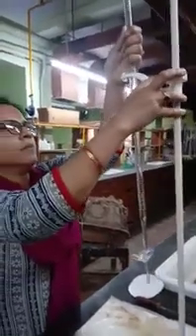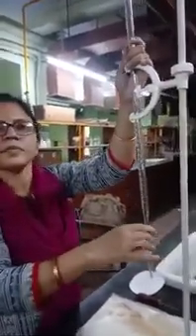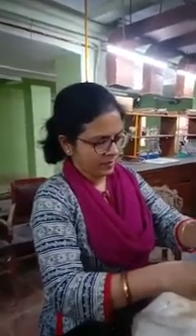Now if you add formalin solution, only the amine group will be blocked, and the carboxylic acid group can be titrated against standard sodium hydroxide. Now you are standardizing the NaOH solution. But the first step of this is you have already prepared a neutral formalin solution. Now the sodium hydroxide, which is a secondary standard, has to first be standardized against a standard oxalic acid solution that you will prepare.